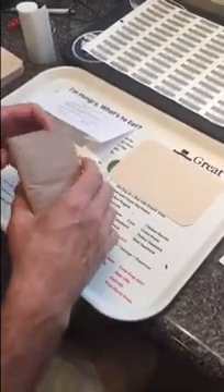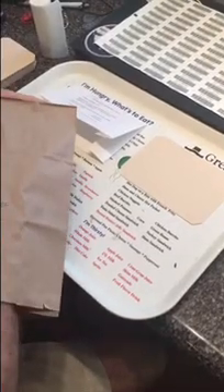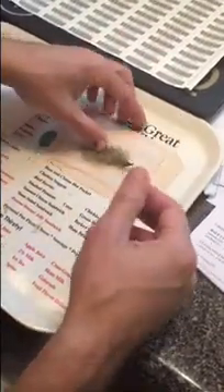Now I want to show you quickly how to process a specimen where you do not use glue. You don't want to actually glue the specimen because that would be bad for it. This is the genus Usnea, a fruticose lichen, and there's really no way to glue it down. So we use a little piece of cotton wadding — just cut a small piece off like so, and it lays underneath the specimen. When this is held upright in an envelope or packet, the specimen does not fall to the bottom and get crushed. This specimen is essentially ready to go.